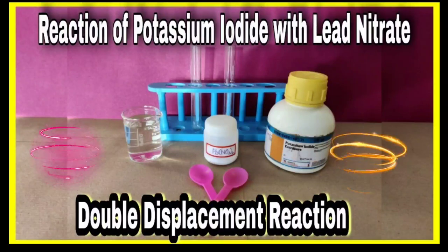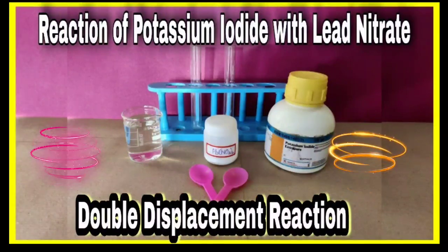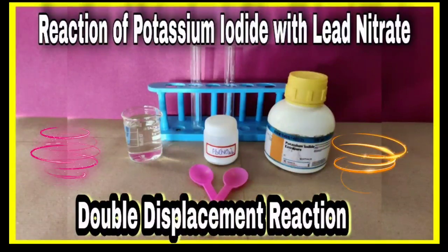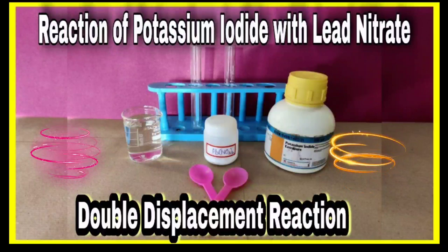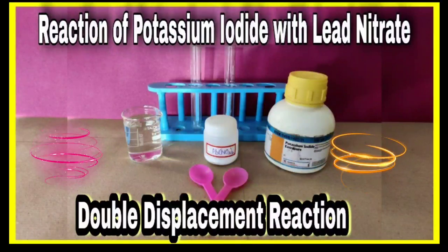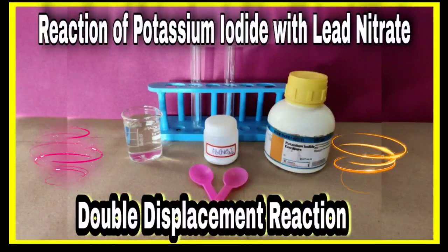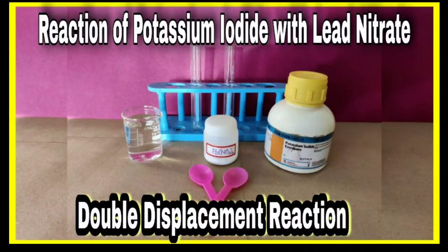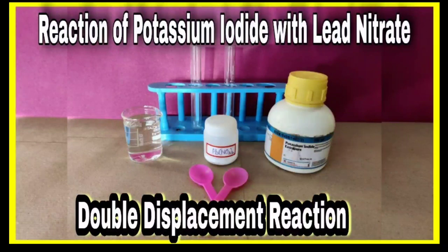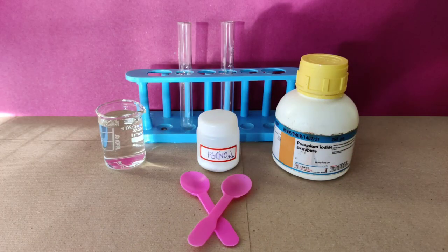Hi students, how are you? Today I will demonstrate an experiment: the reaction of potassium iodide with lead nitrate. It is a double displacement reaction.